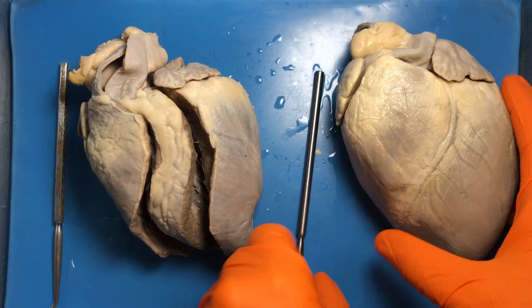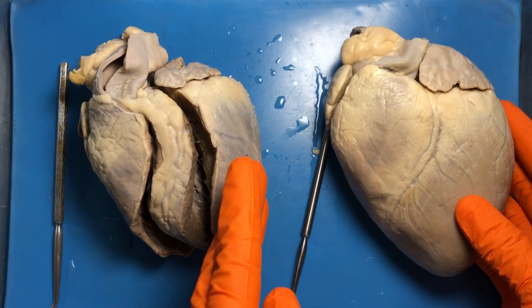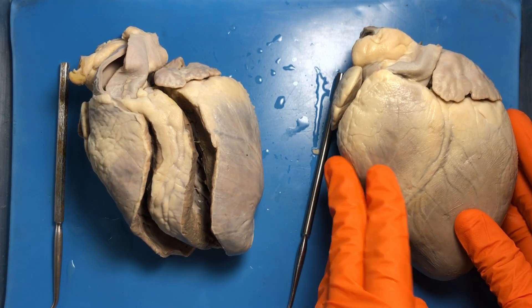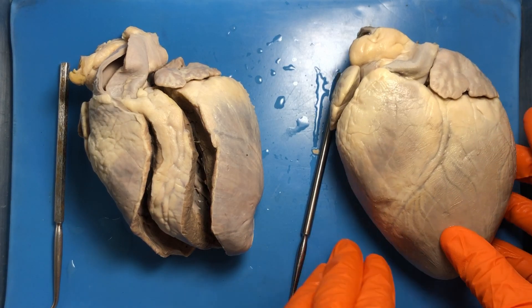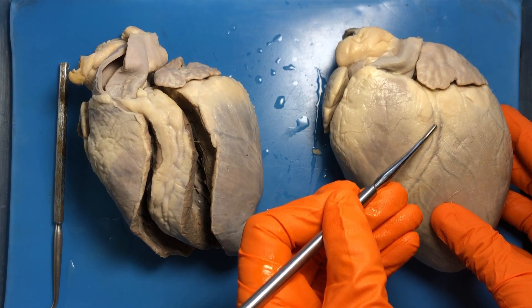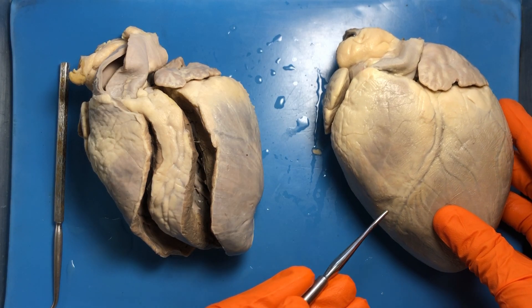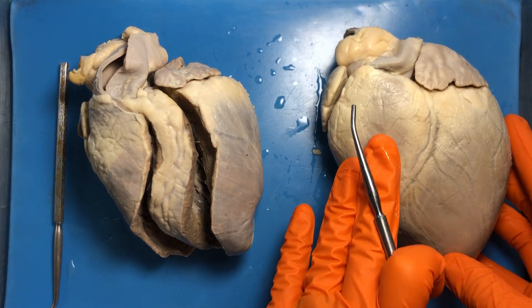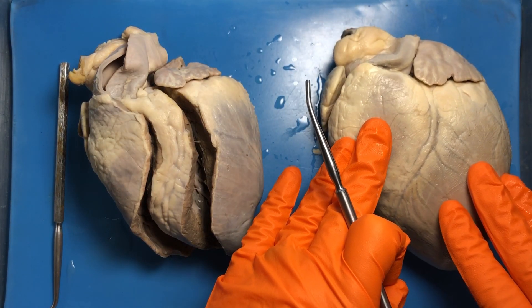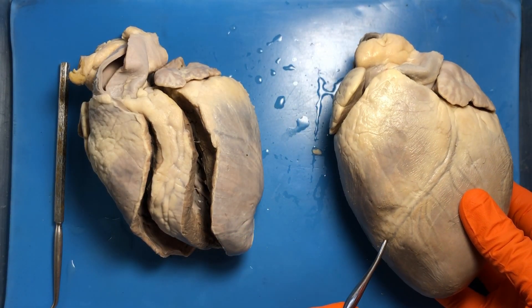Always remember those directional terms from A&P 1 — anterior, posterior, left, right, superior, inferior — they help you identify structures. The first groove I'd like to point out: grooves are called sulci, plural for sulcus. Since we are on the anterior side and it is between the ventricles, this is the anterior interventricular sulcus.